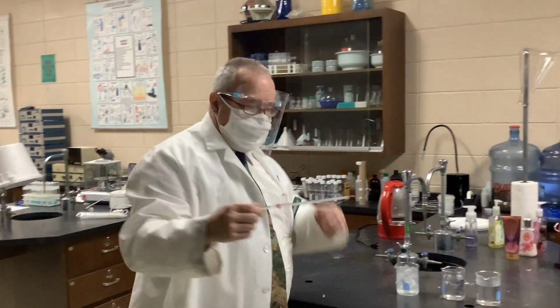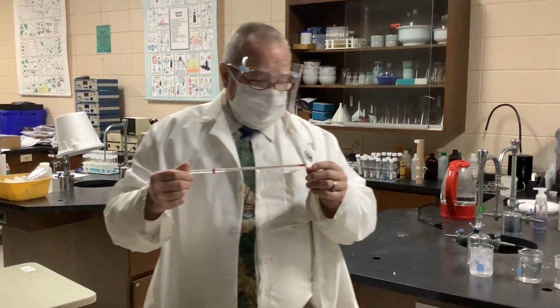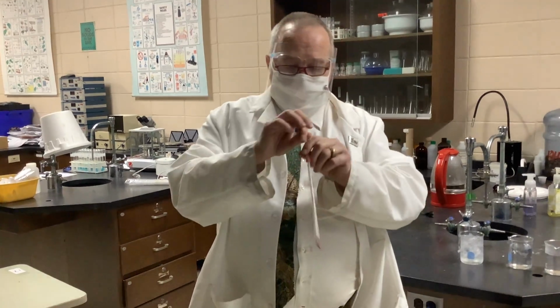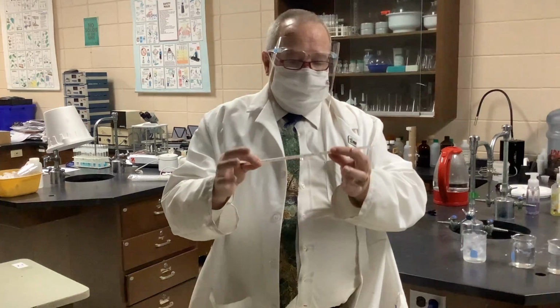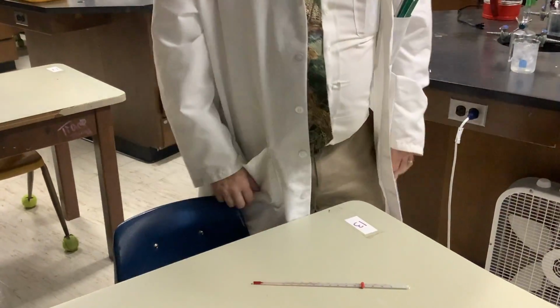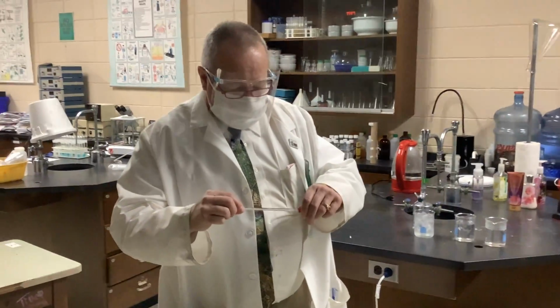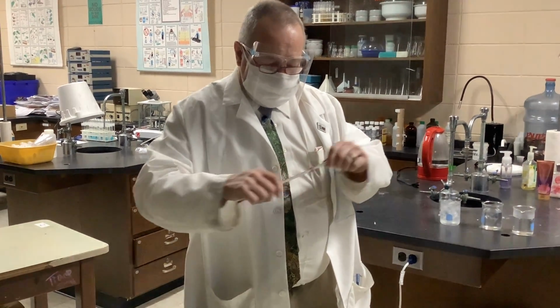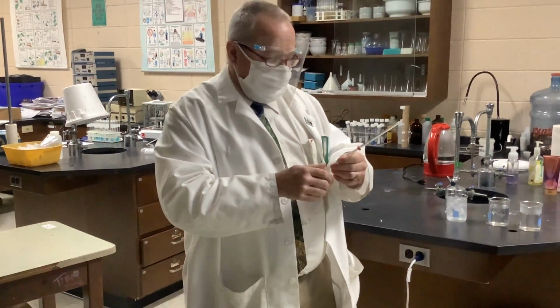This is a standard laboratory thermometer. We now tend to use ones filled with alcohol colored with red food dye, and lots of people ask what this was. This is called a thermometer bumper. It just keeps it from rolling off. I noticed some of the students using it to remember where the liquid inside the thermometer rose to, but we'll remember our values.